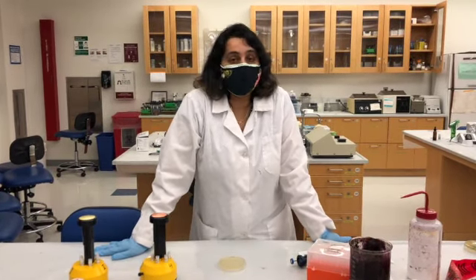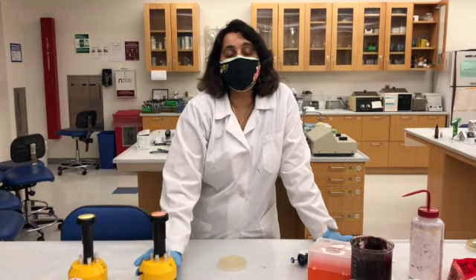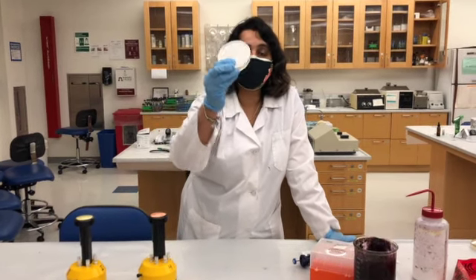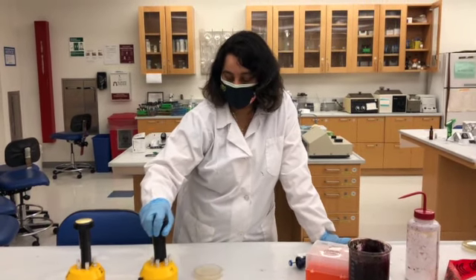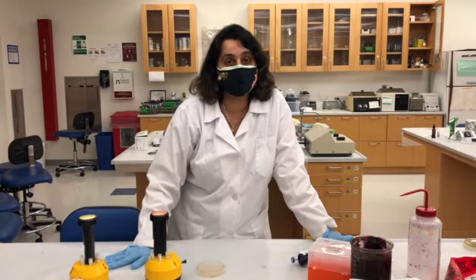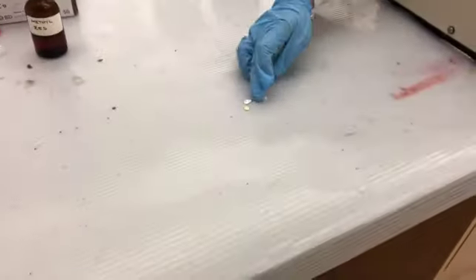So some are narrow spectrum, some are broad spectrum. So you can test whatever antibiotics that you want to. And simply, you grow the bacteria on the TSA plate, you punch this antibiotic dispenser on the plate, and then this antibiotic dispenser would release the so-called filter discs. The filter discs are right on that side. Let me just separate them and show you.